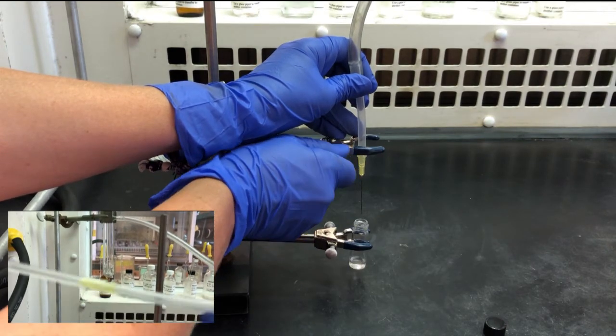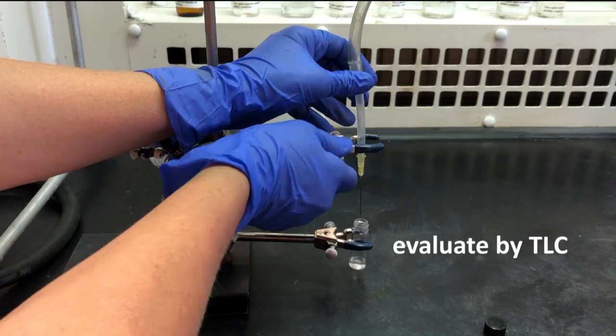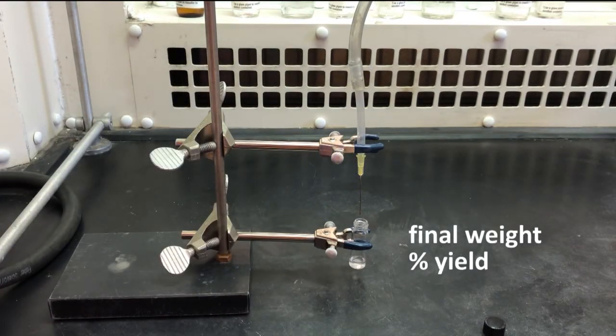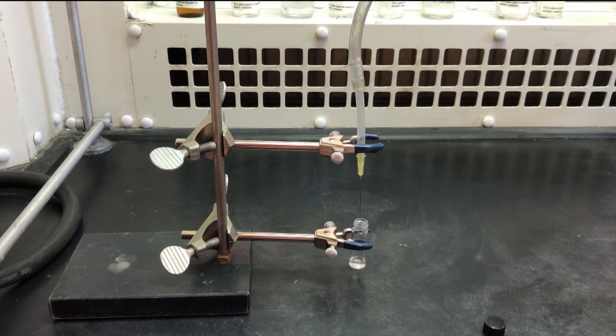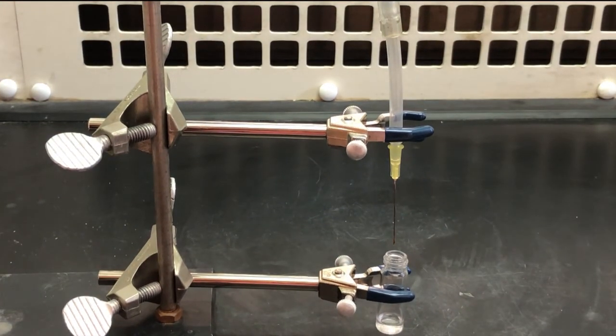As the solvent is evaporating, evaluate the dilute product solution by TLC. Once the solvent has evaporated, determine the final weight and the percent yield. How do we know all of the solvent is gone? First, know how much product you are expecting. Is the product final weight close to that?